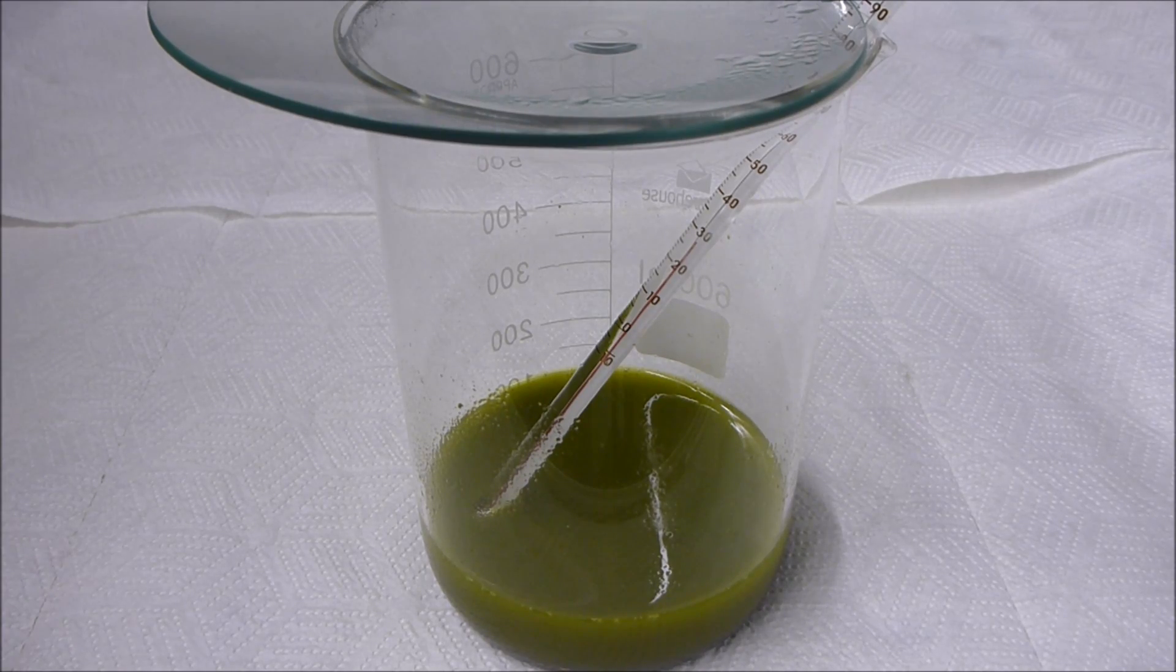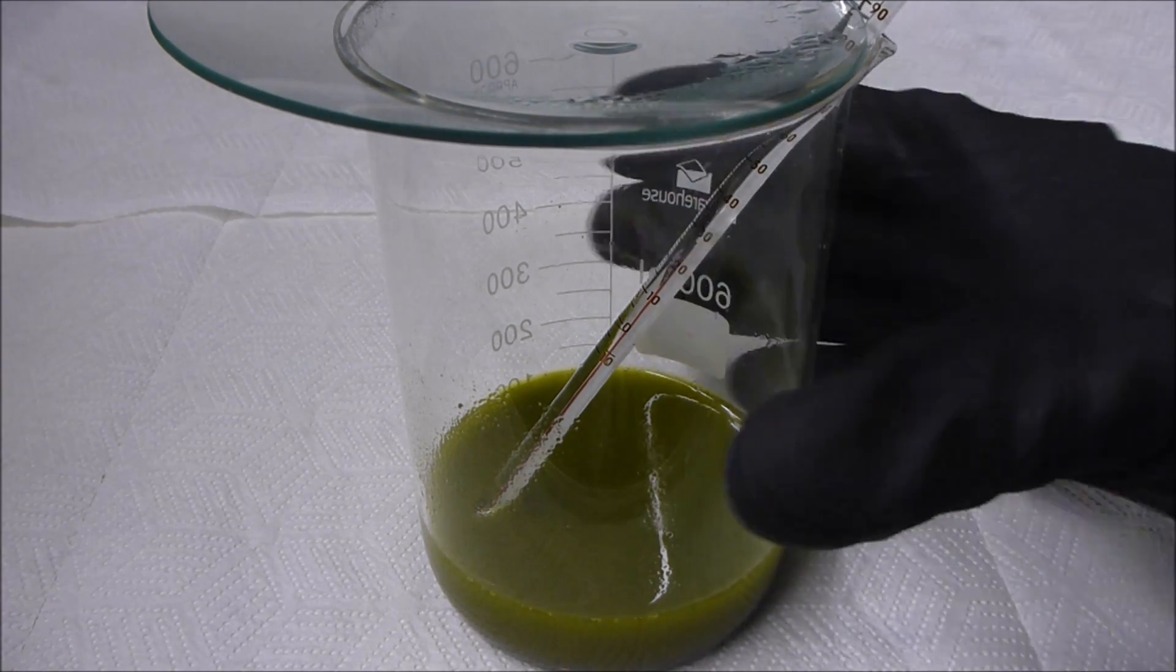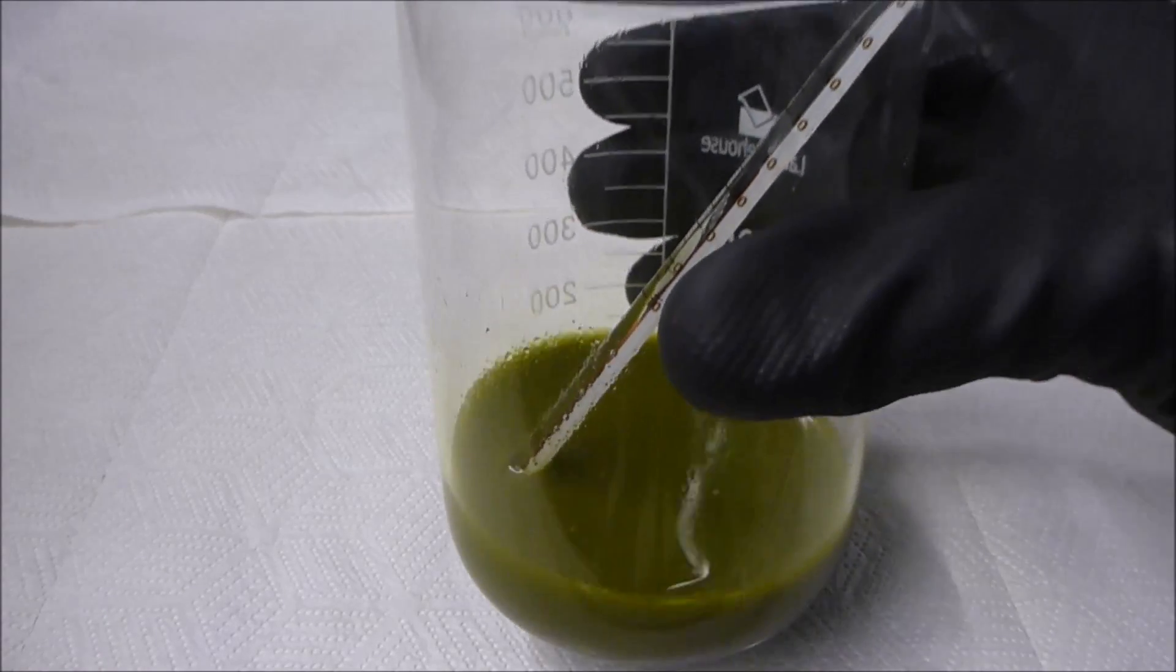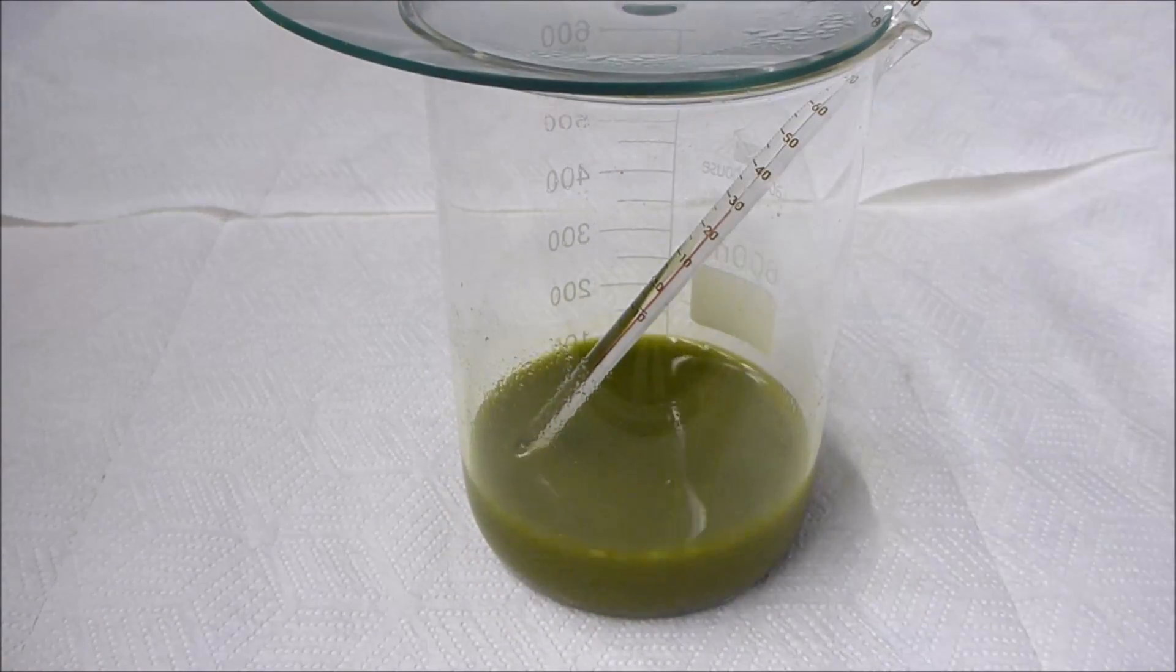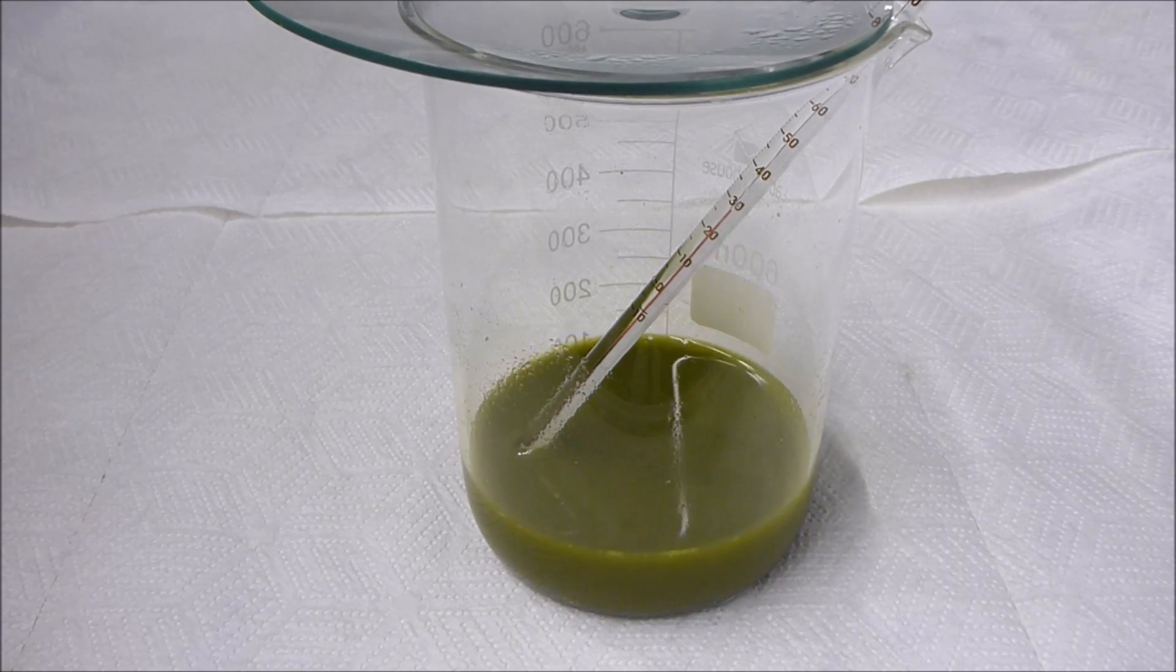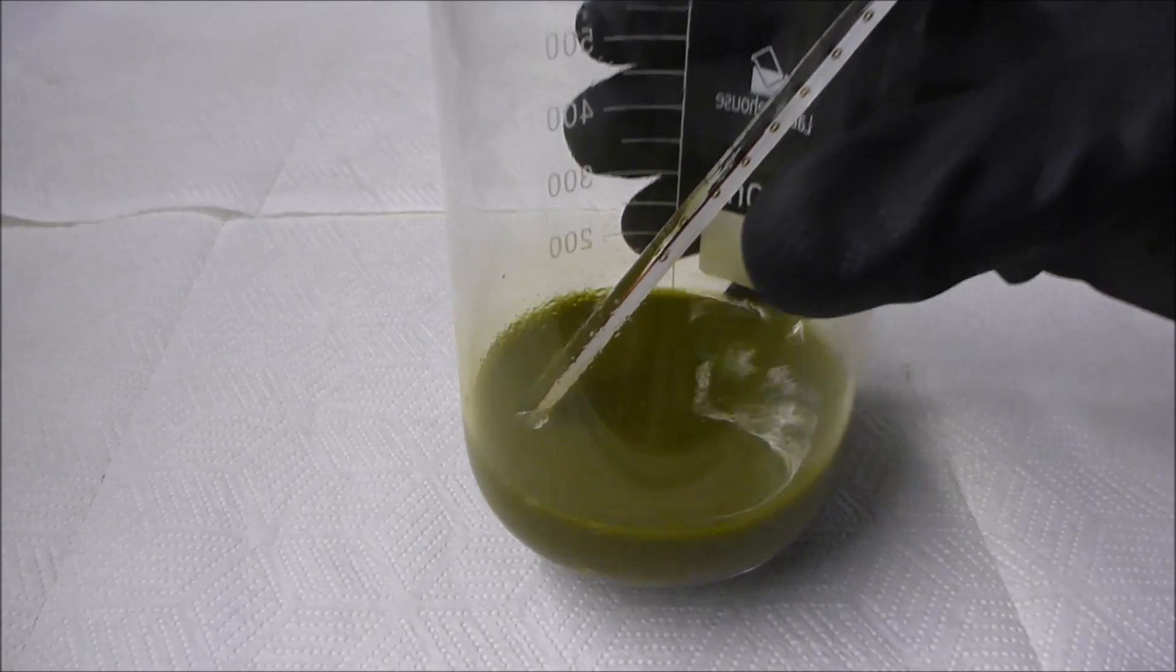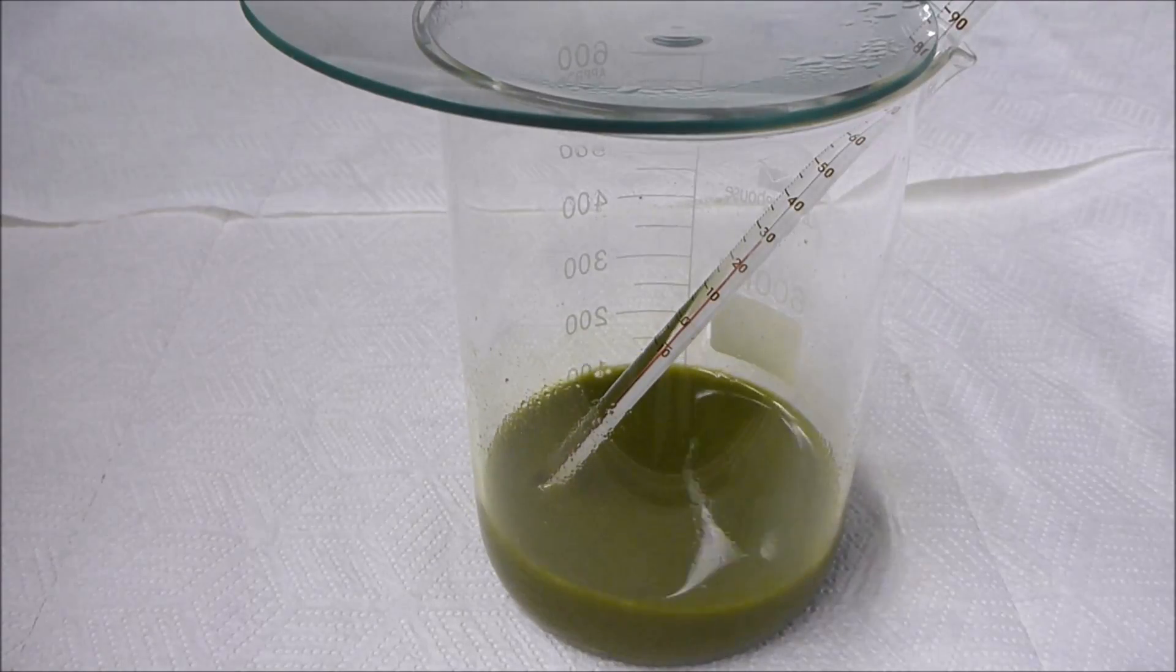What we have here as you will see is a really horrifically polluted pregnant chloroauric acid solution. It's already been denoxed so the excess nitric acid has been converted to sulfuric acid using sulfamic acid.